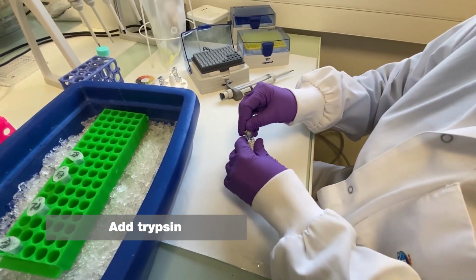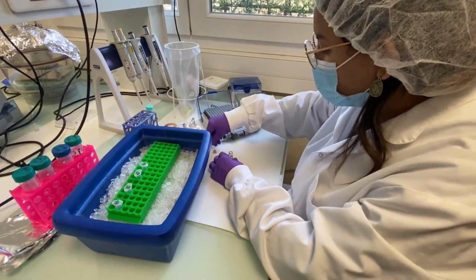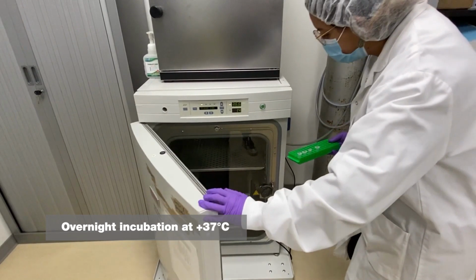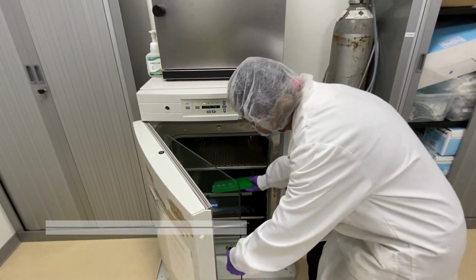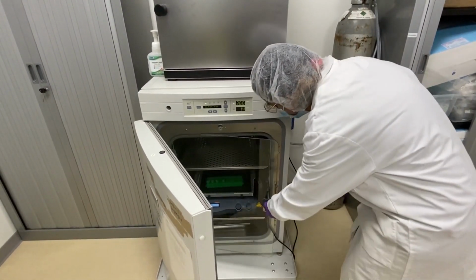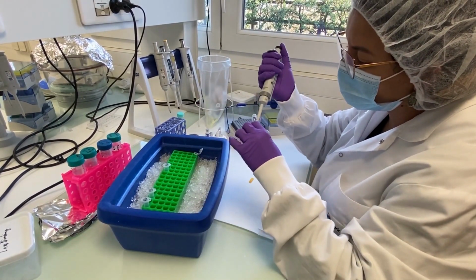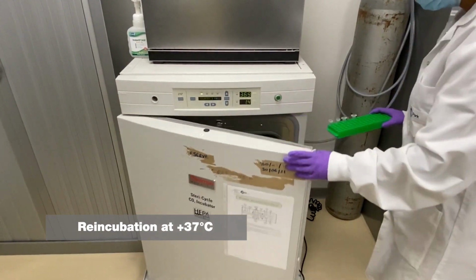For enzymatic digestion, trypsin is used as it generates short peptides easily detected by mass spectrometry, and the samples are incubated overnight at 37 degrees Celsius. After the overnight incubation, the samples are acidified and incubated for an additional 45 minutes at 37 degrees Celsius to stop the reaction.